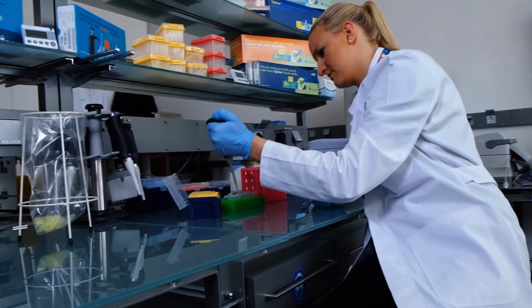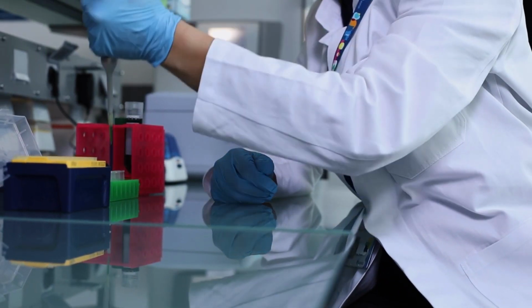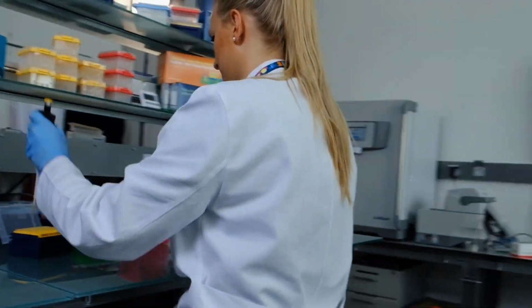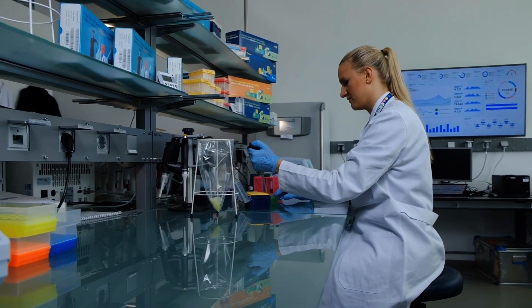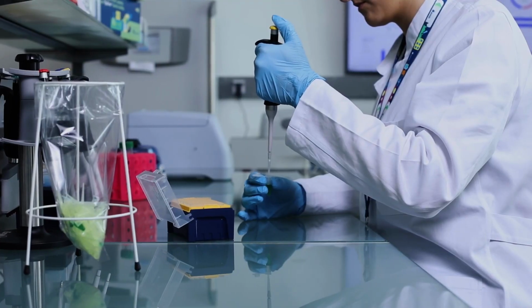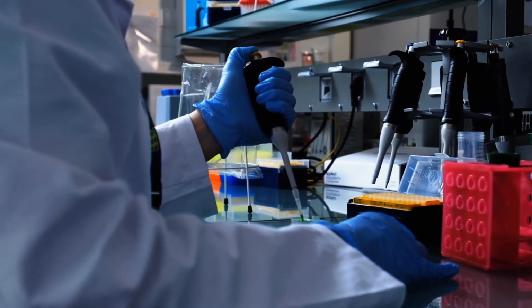If you were sitting at your workspace and you find yourself stretching to reach what you need, or straining to see what you were doing, you won't be producing the best results. Let's take a look at how the pros do it. It's important to be comfortable when pipetting, so you can concentrate on the job in hand. Make sure you are sitting at the bench comfortably, keeping your elbows as close to your body as possible. Try to keep your hand not much higher than your shoulder. This way, we can reduce strain in your shoulder and neck when pipetting together.